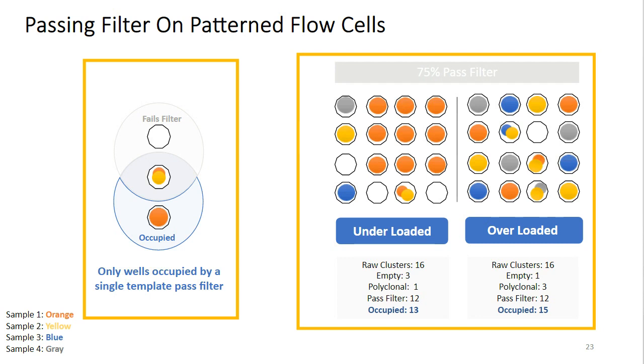Now in this section of the flow cell, we're looking at a fixed number of nanowells that is the same for both scenarios. In the underloaded condition, the majority of the nanowells were seeded with a single template, but there are going to be a higher number of nanowells that are unoccupied.